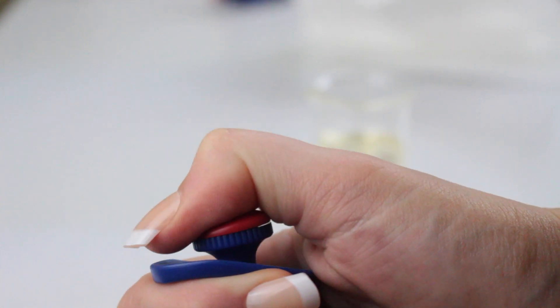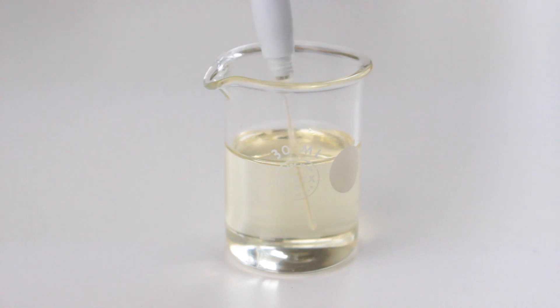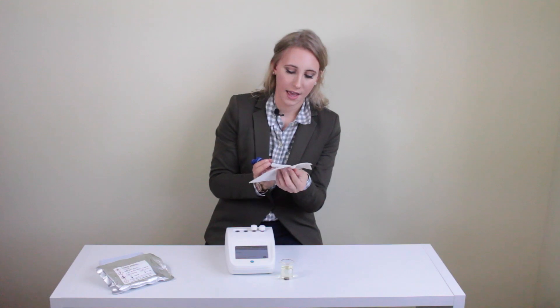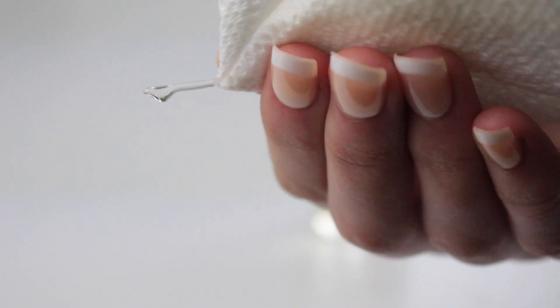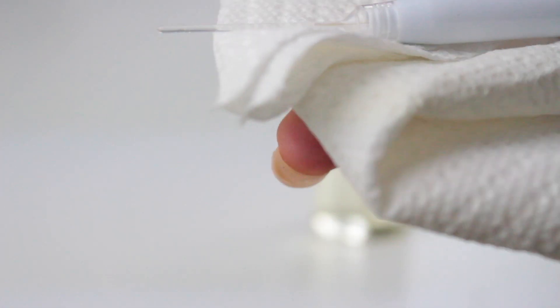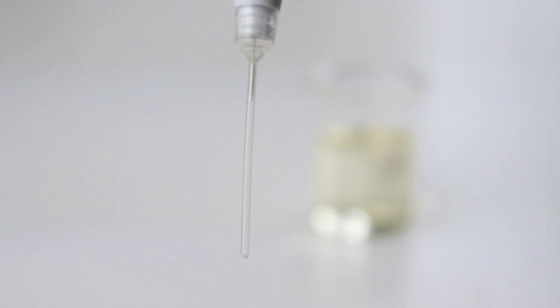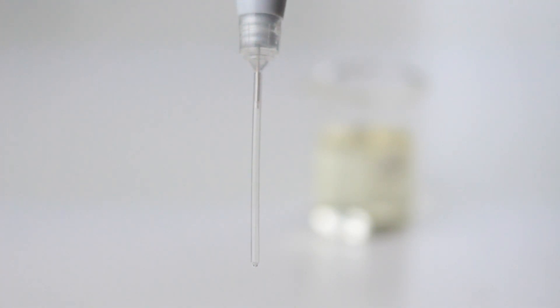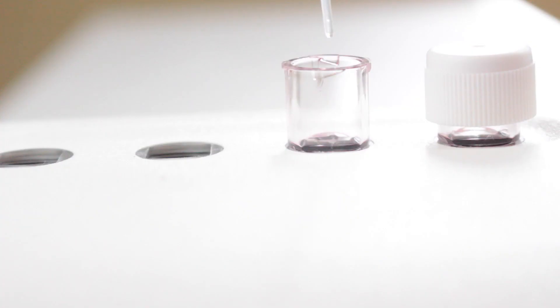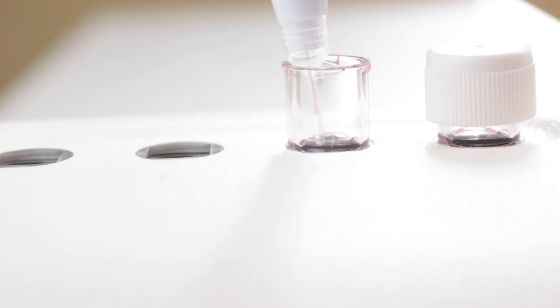After doing so, make sure that the piston on the pipette is pushed all the way down, go into your oil, and draw slowly. Take your paper towel or KimWipe and wipe off the excess oil on the pipette tip, but when doing this make sure that you don't touch the very tip of the pipette. Examine the pipette tip and make sure that there are no air bubbles or particulate in the oil.